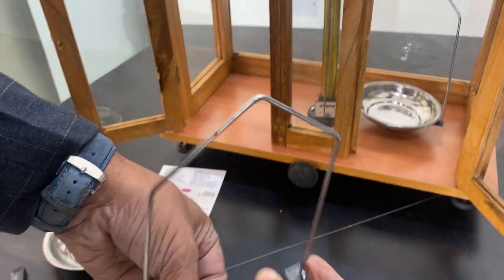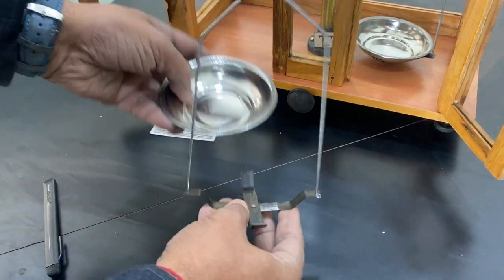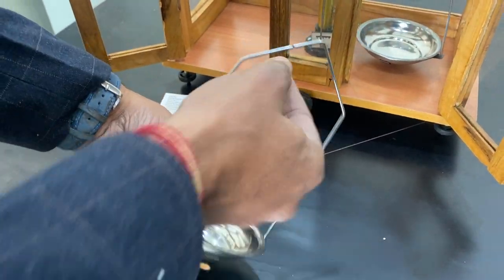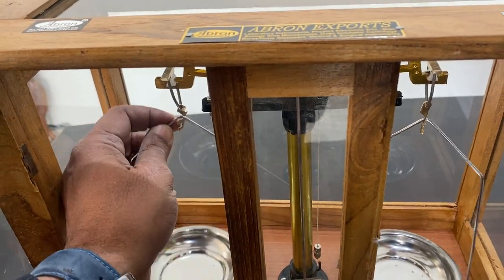Similarly on this side, I open it. There is one spot and one line matching - I place the balance on the second side.